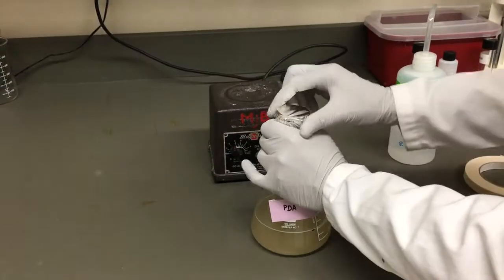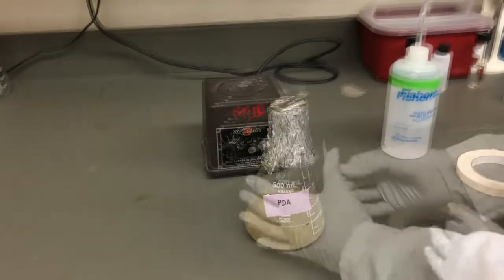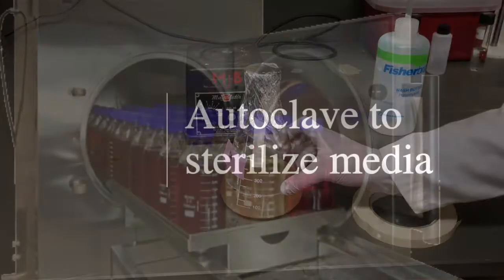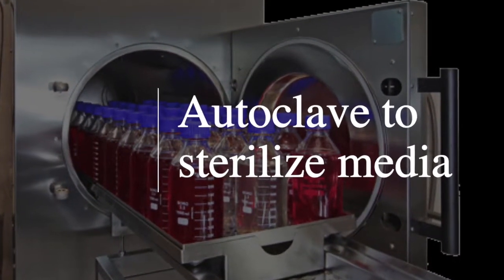Wrap the opening of your flask with aluminum foil and add a piece of autoclave indicator tape to ensure proper sterilization. Autoclave your media sterile if applicable, otherwise filter sterilize.